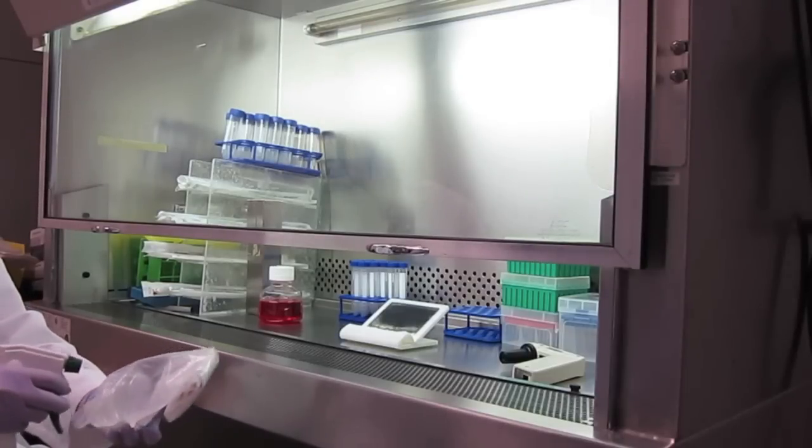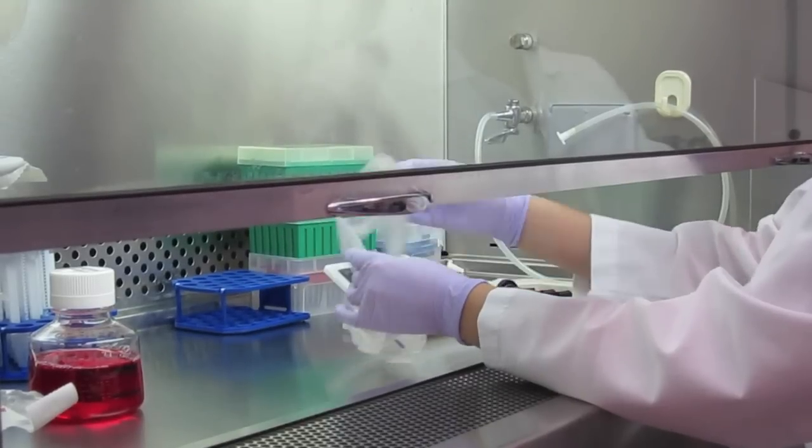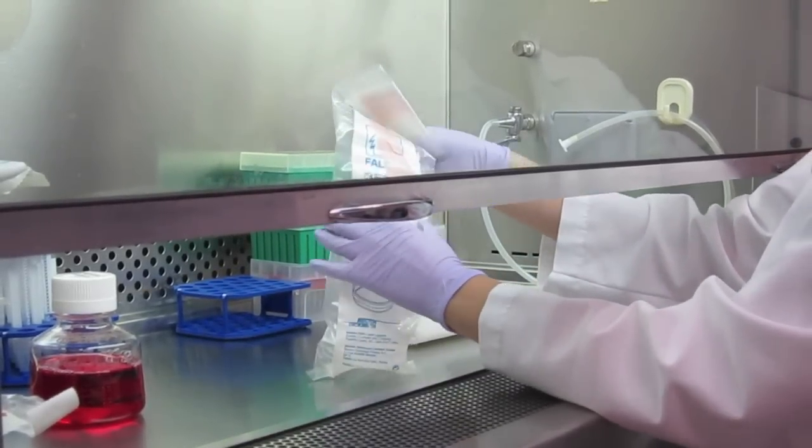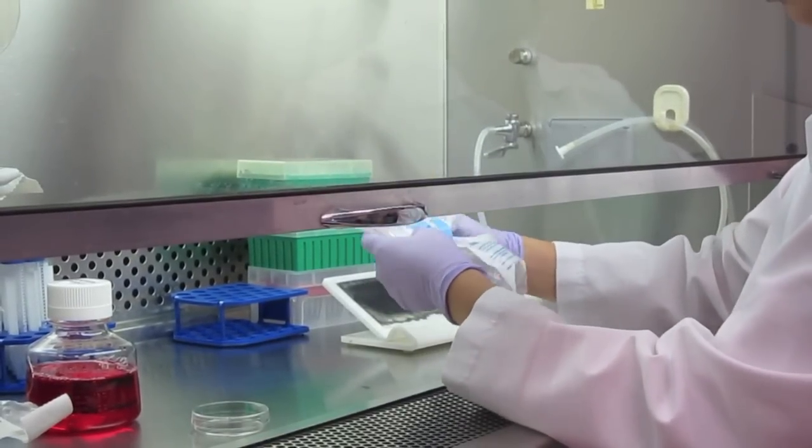When working with well plates or stocks of tissue culture dishes, spray down the wrapping and open in the biosafety cabinet. In cases in which a stock bag of dishes is opened, be sure to seal the bag inside the BSC.